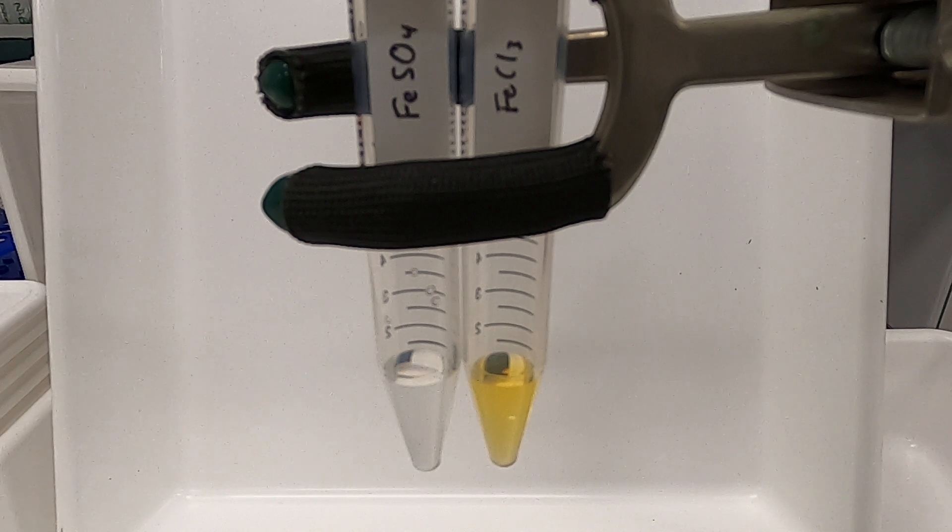And we're going to compare what happens when we neutralize each of these solutions and oxidize one of them as well.